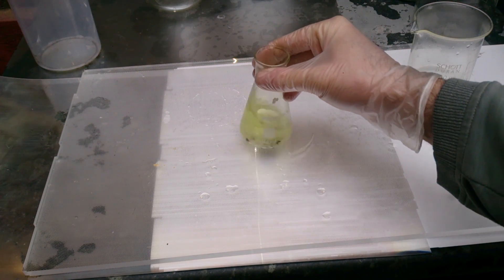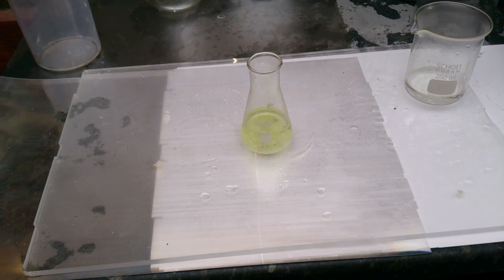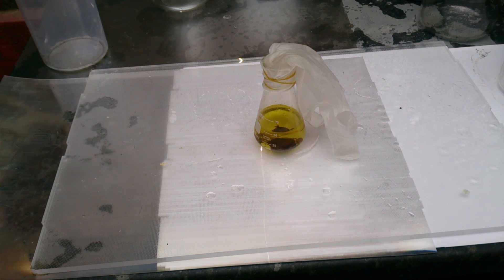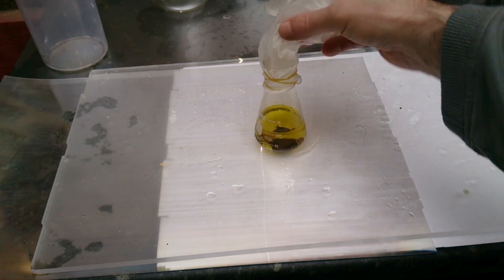Right now I'm using magnesium nitrate - not because I like it, not because I'm supposed to use it, but just because I got it cheap. So I'm just mixing it with hydrochloric acid, and if it's not enough, I just add a bit more nitrate. Just waiting till all the nitrate dissolves. At this point, you do not have to apply any heat - just wait. At first the reaction will be exothermic and will produce quite a lot of heat itself. Even now it's winter time, heating it straight away is a bit overkill.